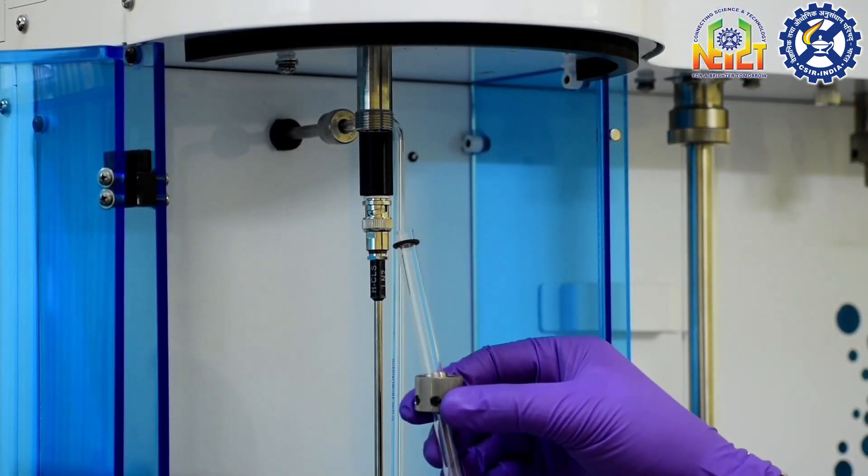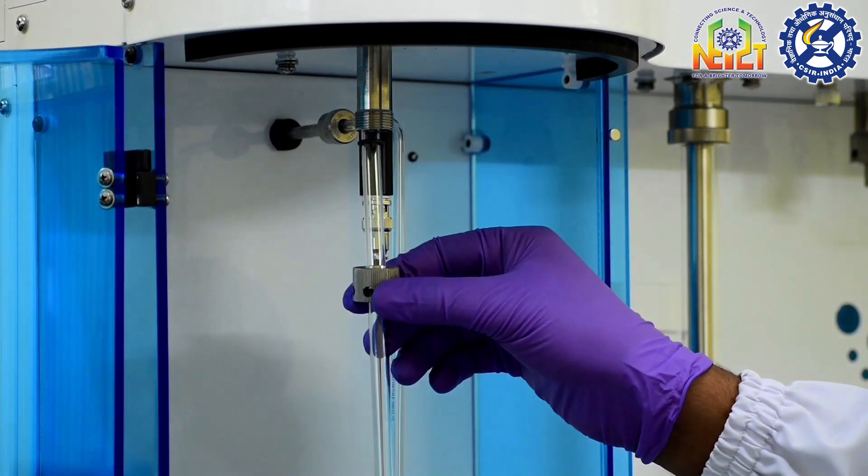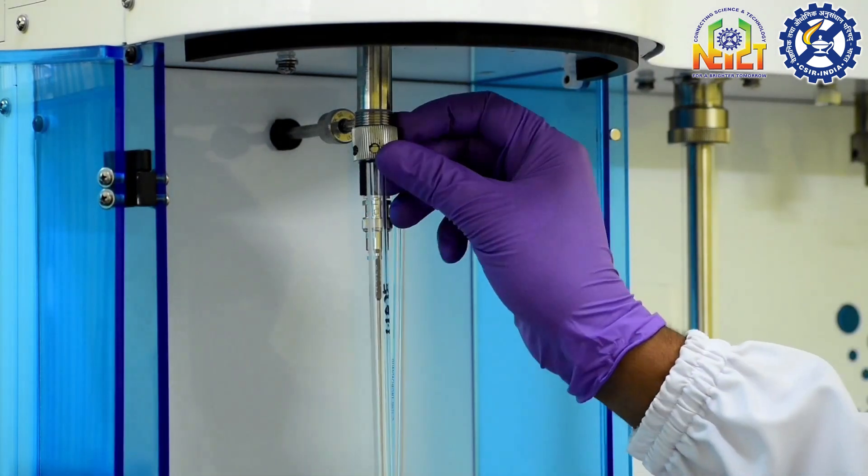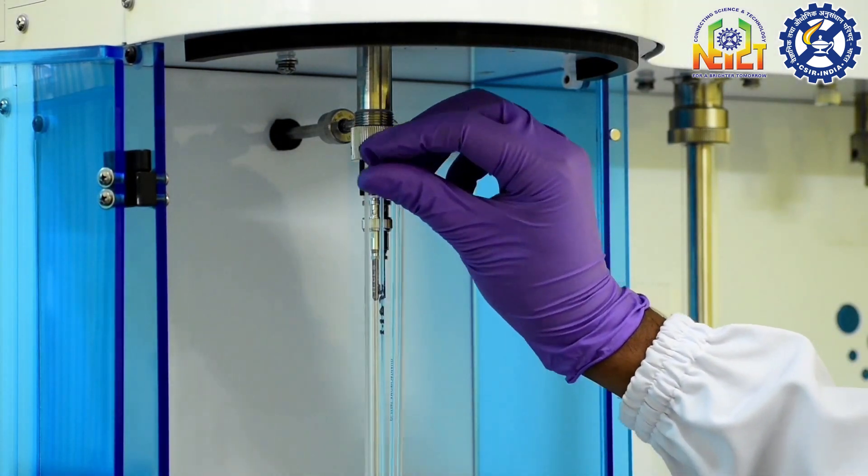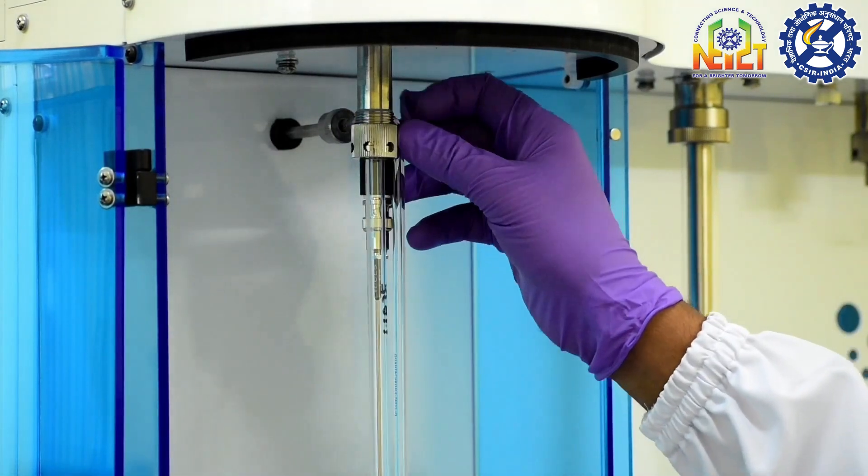After degassing the sample cell were fed into the analysis port. The time for degassing depends upon the nature of the sample.